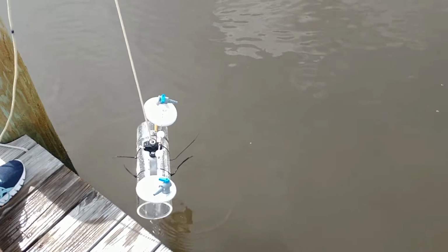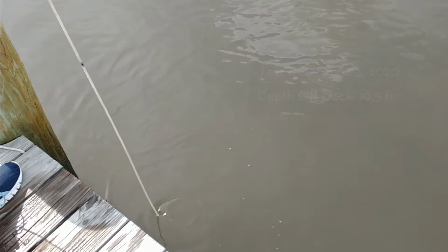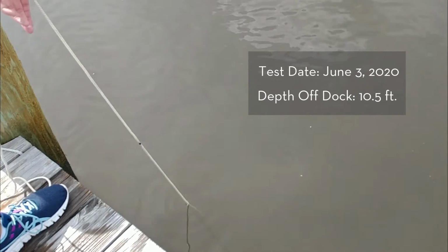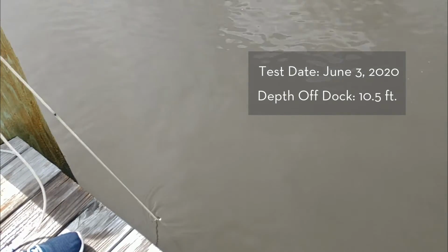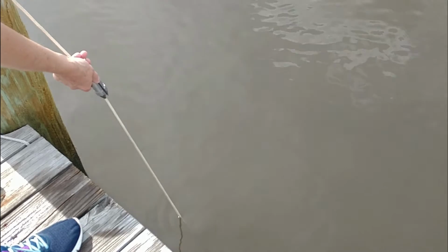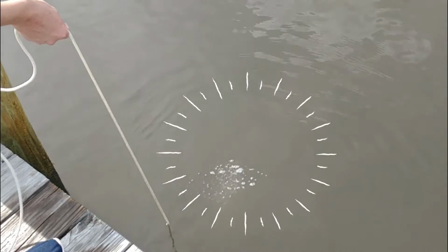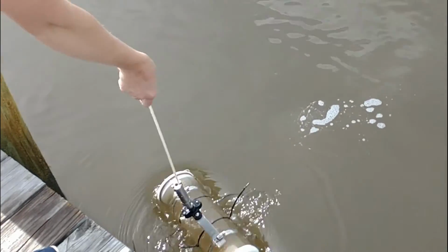We're going to lower our Niskin bottle into the water. You can see the stoppers are in the open position. How I know we've reached the river's bottom is that the line will actually go slack. All right, so there's a little slack in the line. I'm going to attach the messenger. Make sure it's closed and locked in place. And I'm going to send it down to close those stoppers. What you're looking for are the bubbles. There they are. We're going to raise it back up and we should have our benthic water sample, which we do.